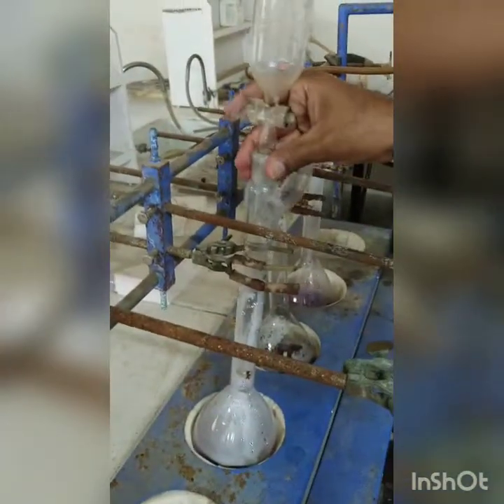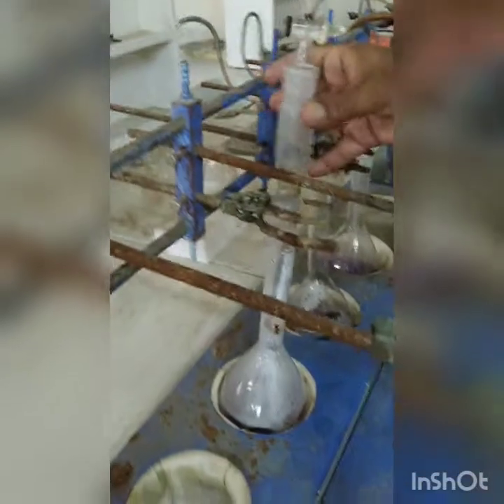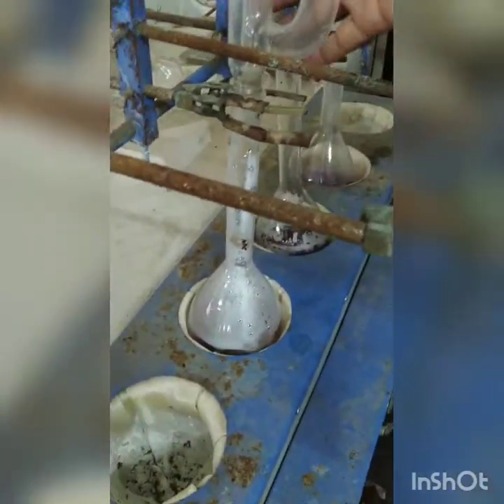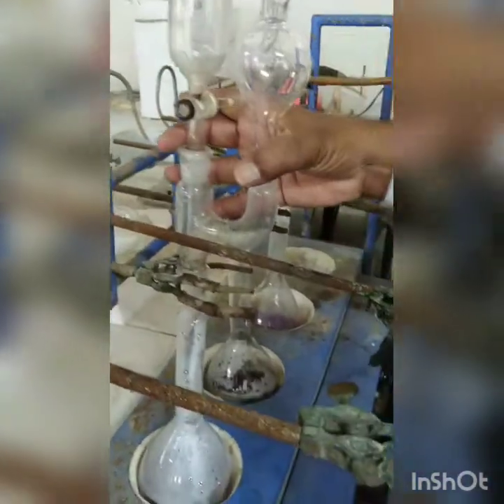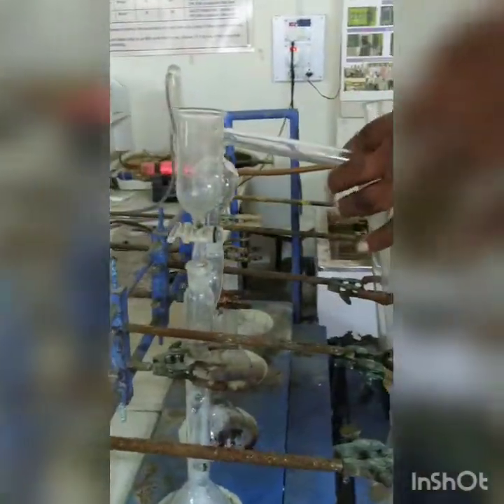So you can see, we will show you for one of the distillation flasks. So wherein the sample, this is sample or blank? Sample, no? Yes. So for the sample, we are arranging the distillation assembly, as you can see here. So it is to be assembled properly.